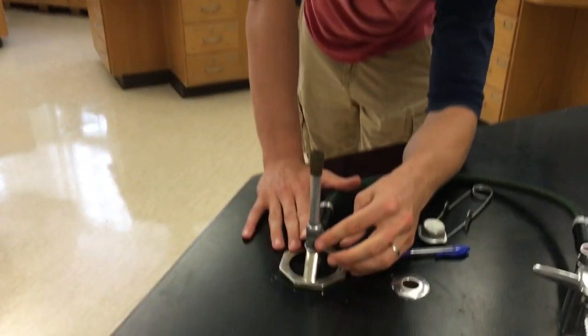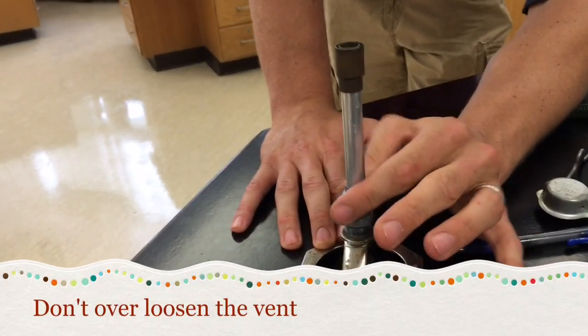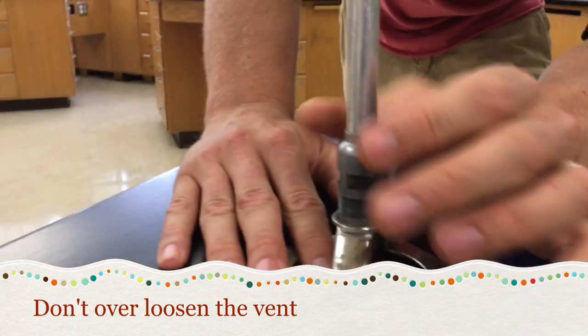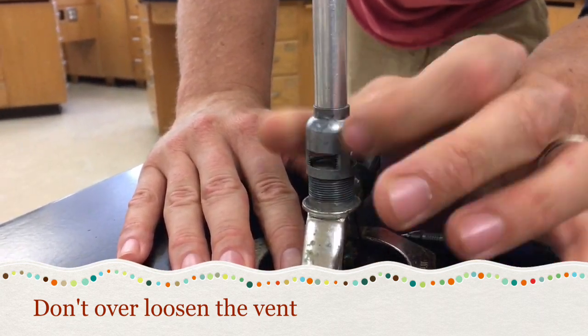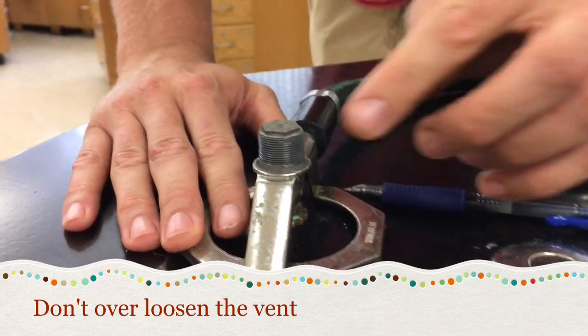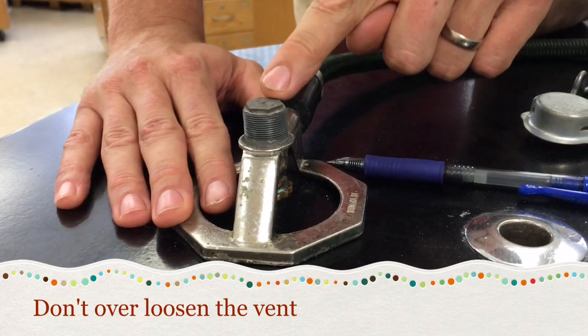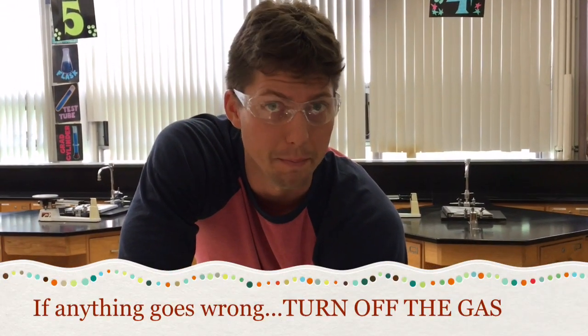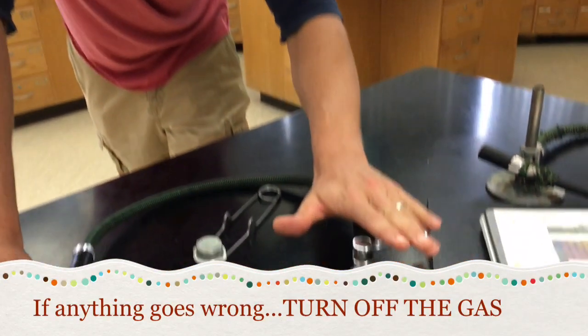Another big one — I'm actually going to turn it off to show you this. The valve that adjusts the oxygen is on a thread, and if you over-loosen it, it will start to get wobbly. If you continue to do that, the top will fall and the flame will jump to there. If that or anything scary ever happens with the Bunsen burner, don't panic. The first thing you want to do is turn the gas off. Call your teacher over right away. If there is any question of smoking or anything whatsoever, turning off the gas is going to be the first thing to do.